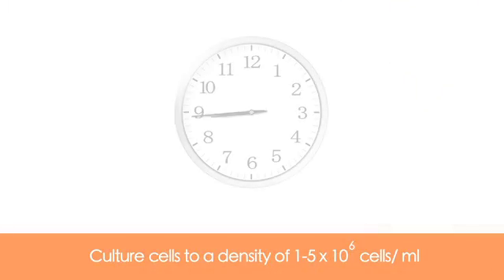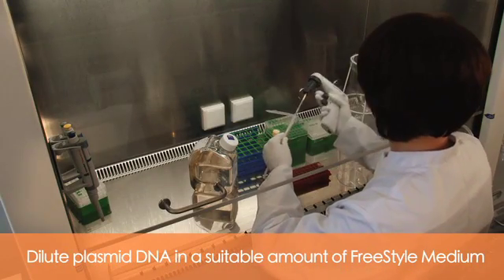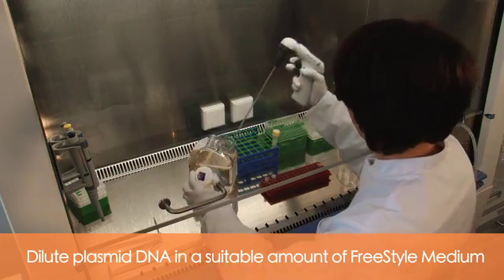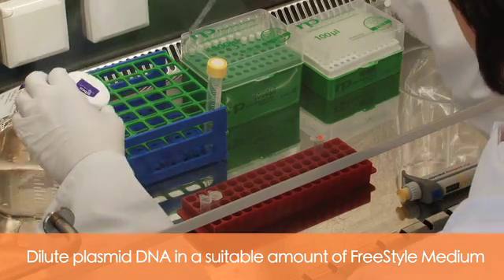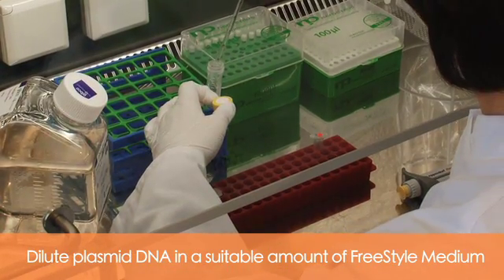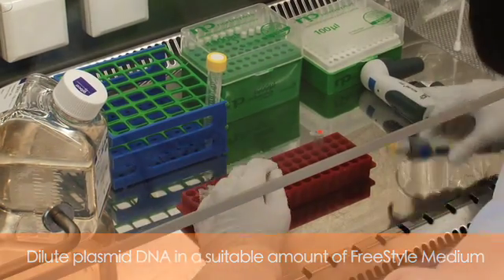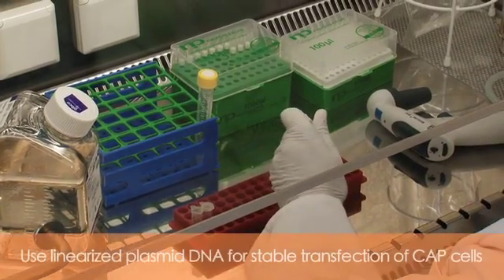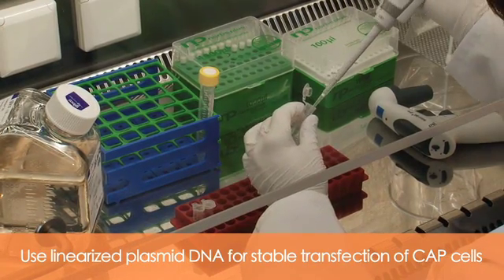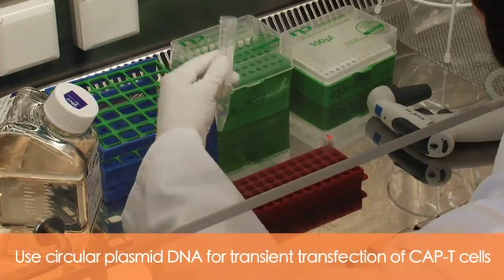Culture cells until a density of 1 to 5×10⁶ cells per mL is reached. In a 15 mL centrifuge tube, dilute your chosen plasmid DNA in a suitable amount of freestyle medium. Use linearized plasmid DNA for stable transfection of CAP cells, and circular plasmid for transient transfection of CAP T cells.